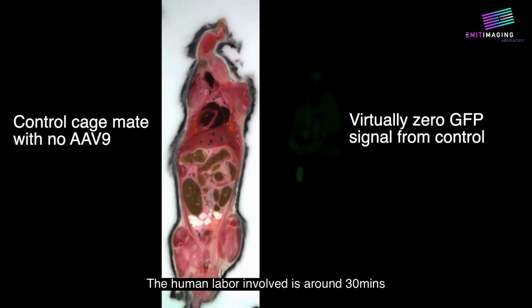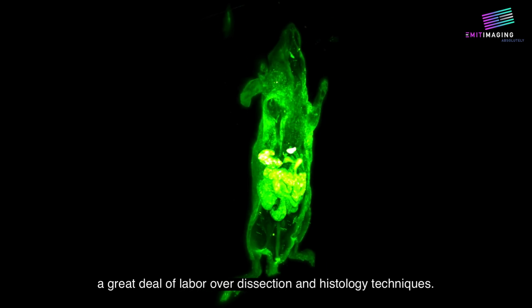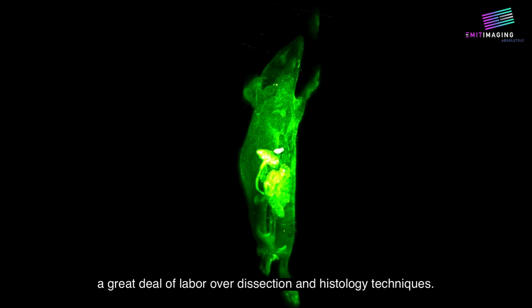The human labor involved is around 30 minutes before the machine will run automatically, which saves a great deal of labor over dissection and histology techniques.